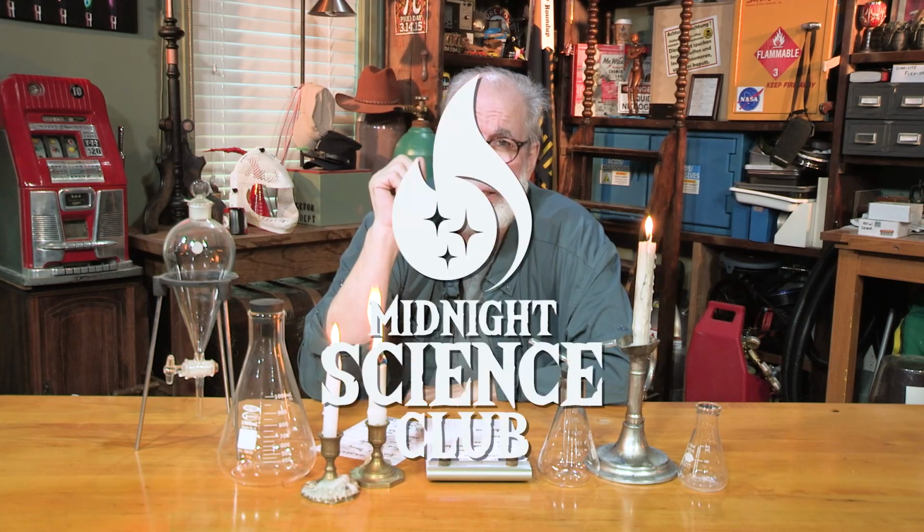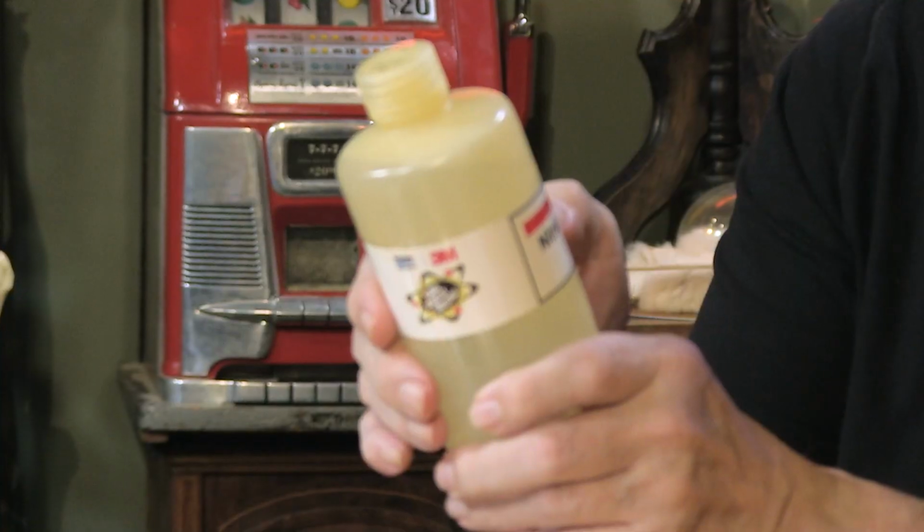Nitric acid's mean stuff, and we used highly concentrated nitric acid. So let's see what it does to a penny. You know, DragonCon has to be safe. There are a lot of things we can't take into DragonCon, and we'd like to take them in, but they can't do it. So we've got to do it here in the laboratory. So here's, for our friends at DragonCon, something we just couldn't do in the theater, and I've got a bottle of liquid.